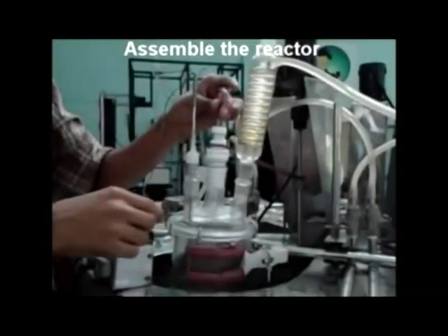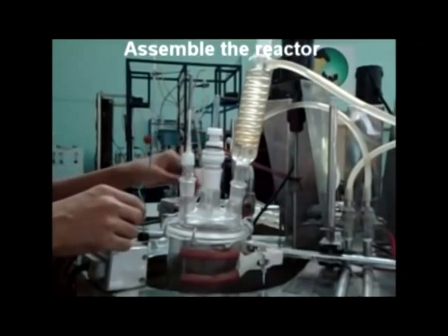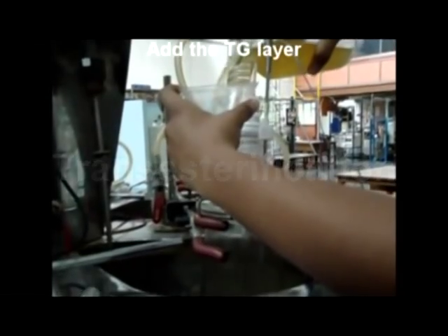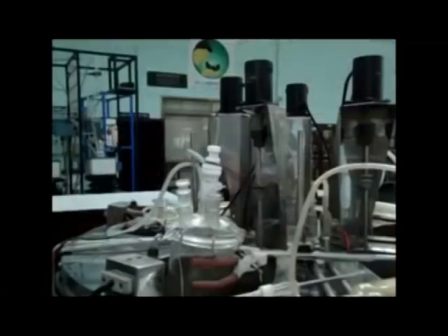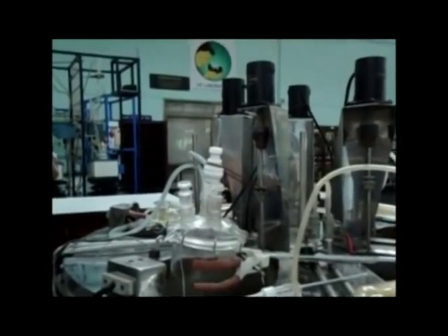Now connect the temperature sensor, the stirrer, and the condenser. After 15–20 minutes, add the triglyceride solution to the reactor and allow the reaction to take place for the next 2 and a half hours.